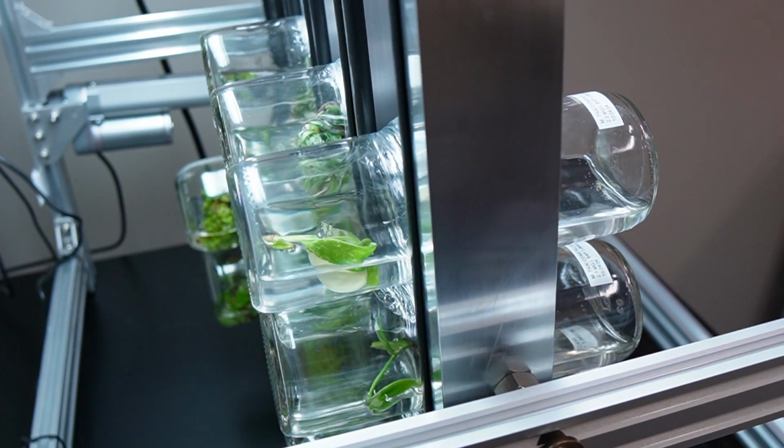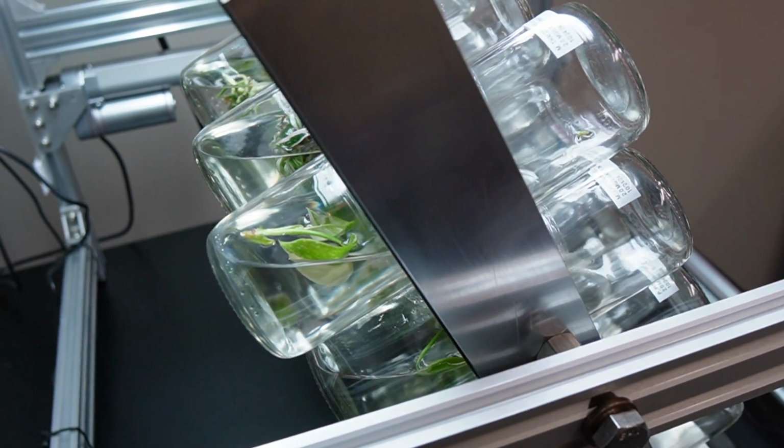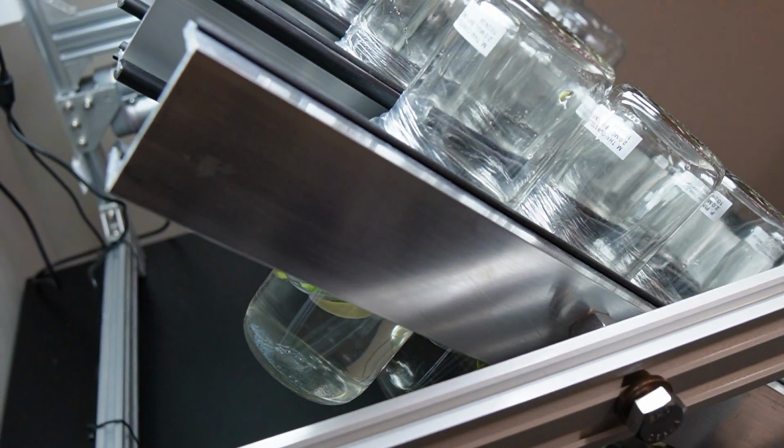BioCouplers are a very simple temporary immersion bioreactor. A few times a day, the BioCouplers get turned 180 degrees to expose the baby plants to that liquid tissue culture media. I made a whole BioCoupler video recently. It got demonetized because I said the C word. Not the C word you're thinking of though.